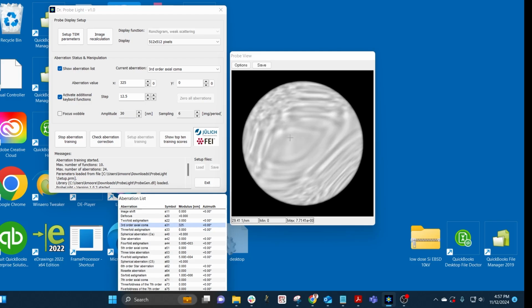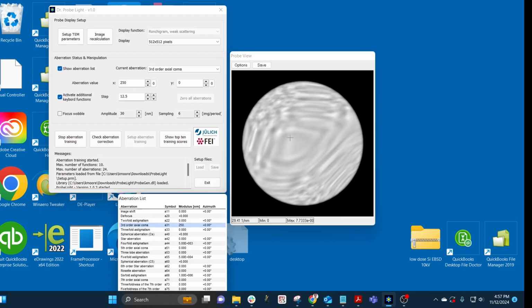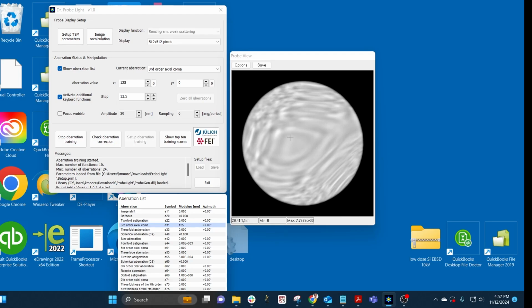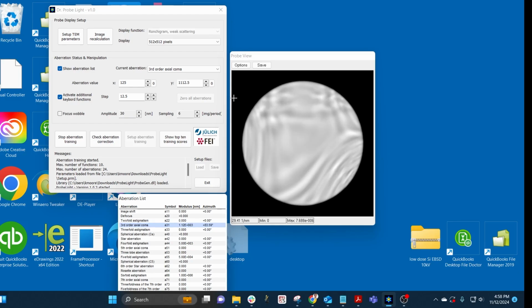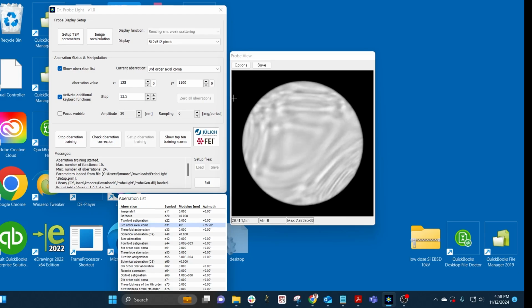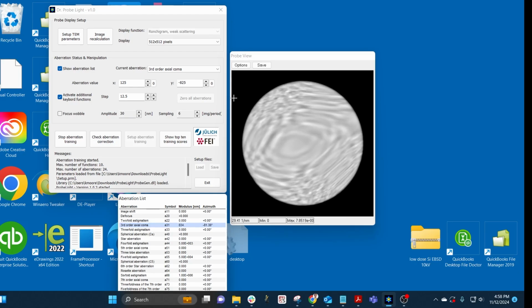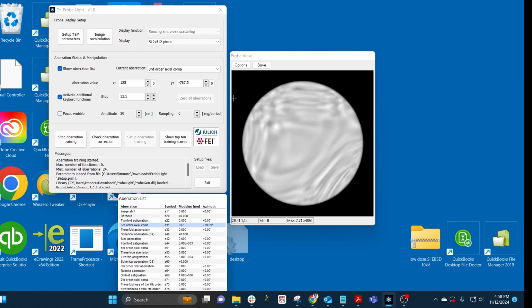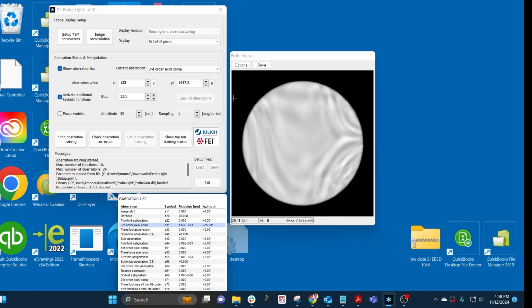and so I'm adjusting it, and there's a little bit of rotation there, if you can see that. It's rotating, so I'll try to put it back to where it was initially and then switch to my other one. So this is getting bigger, which is good. If I went the other way, it gets smaller, it zooms away from me, so that's the wrong direction. So we're going to try and make it bigger, which is good, and then that characteristic shape starts to disappear, which is actually great. That's exactly what we want.